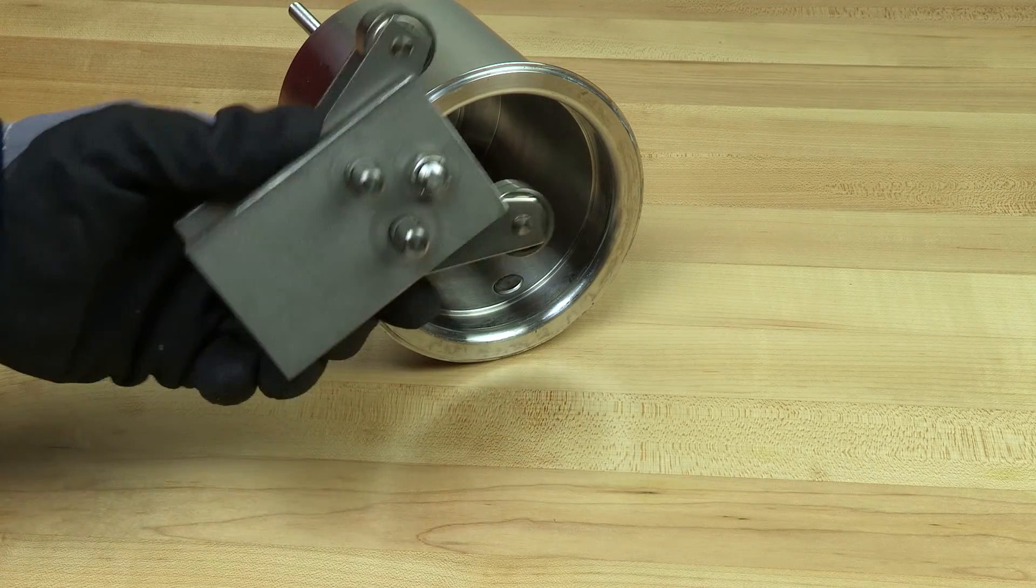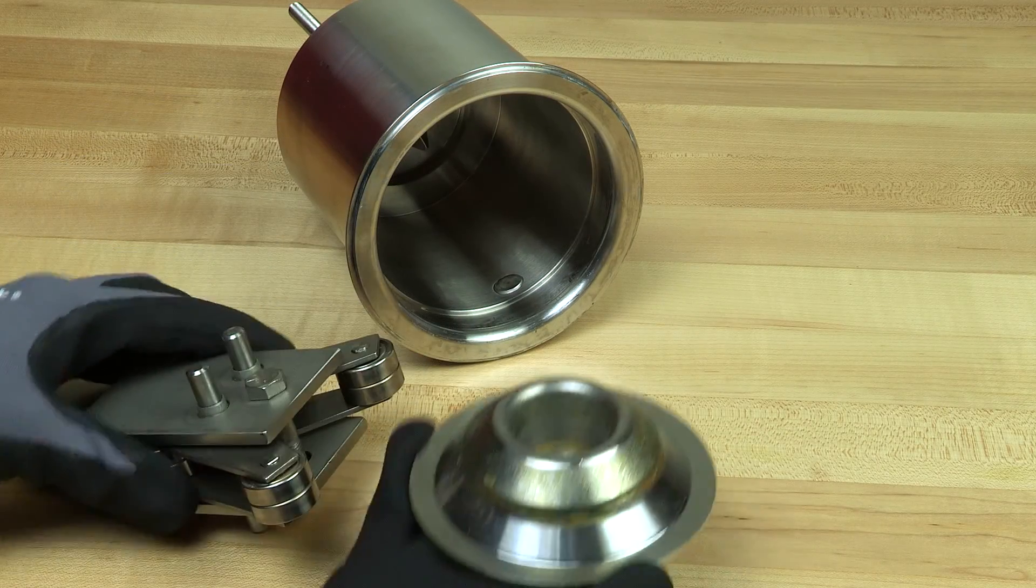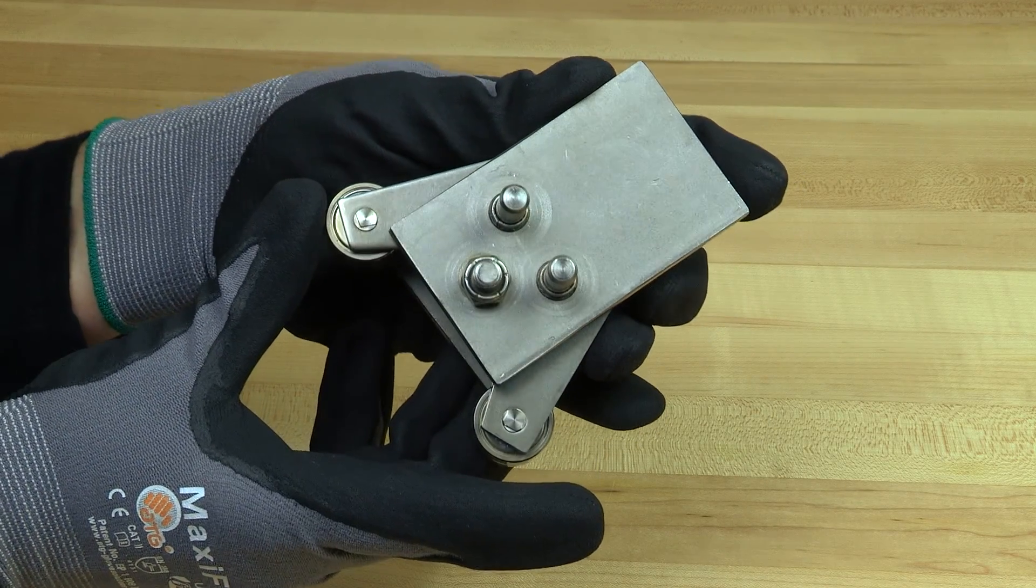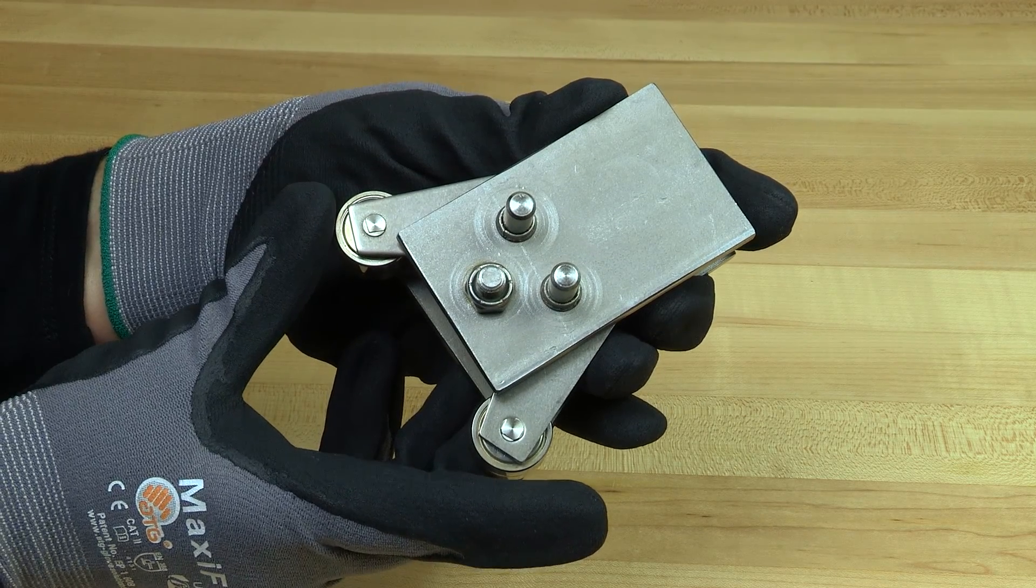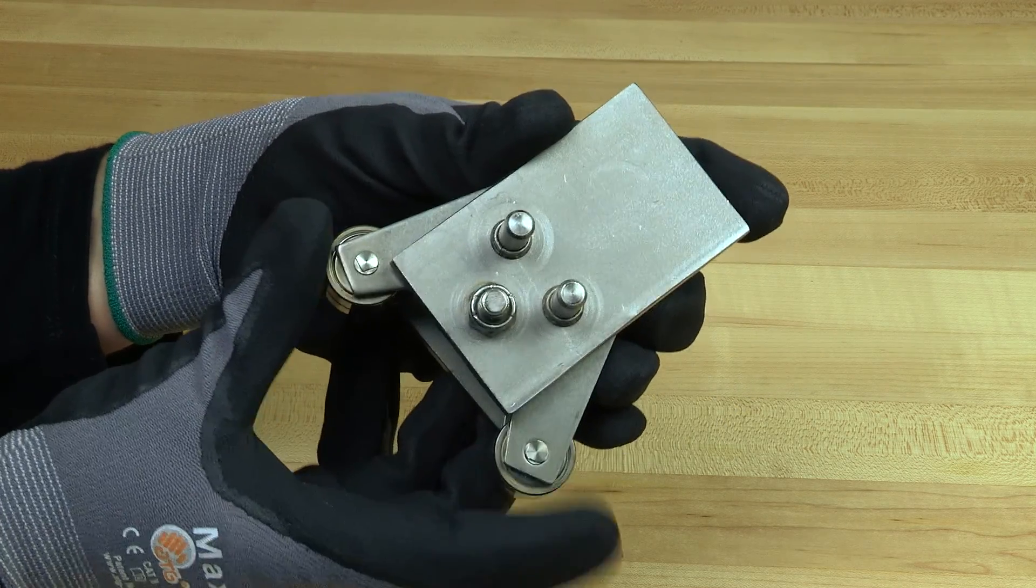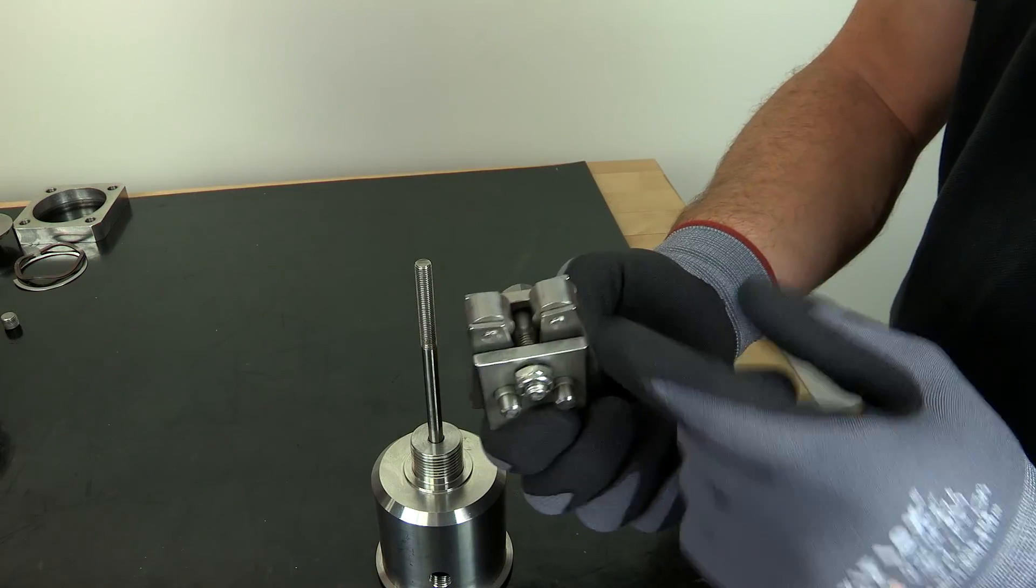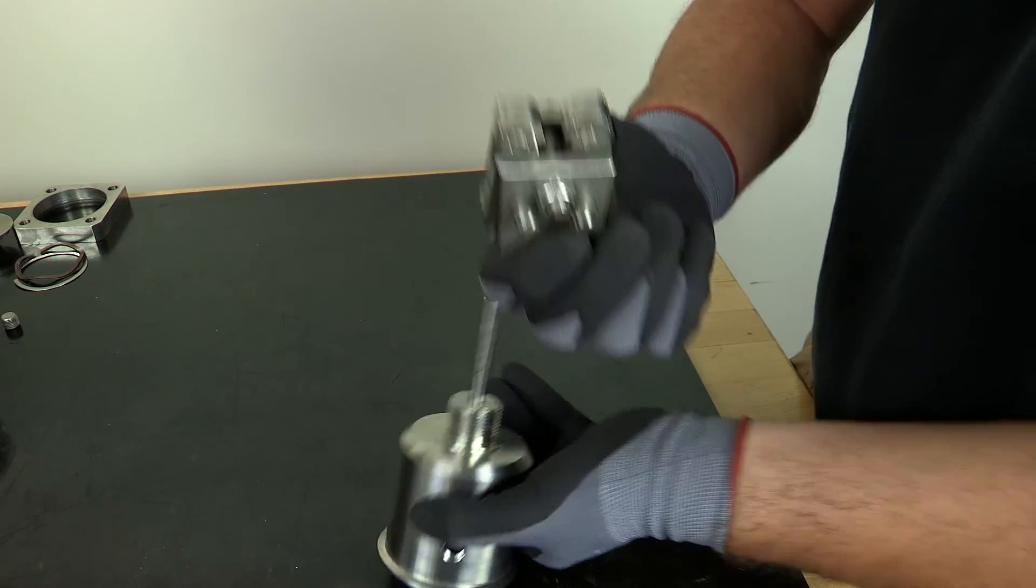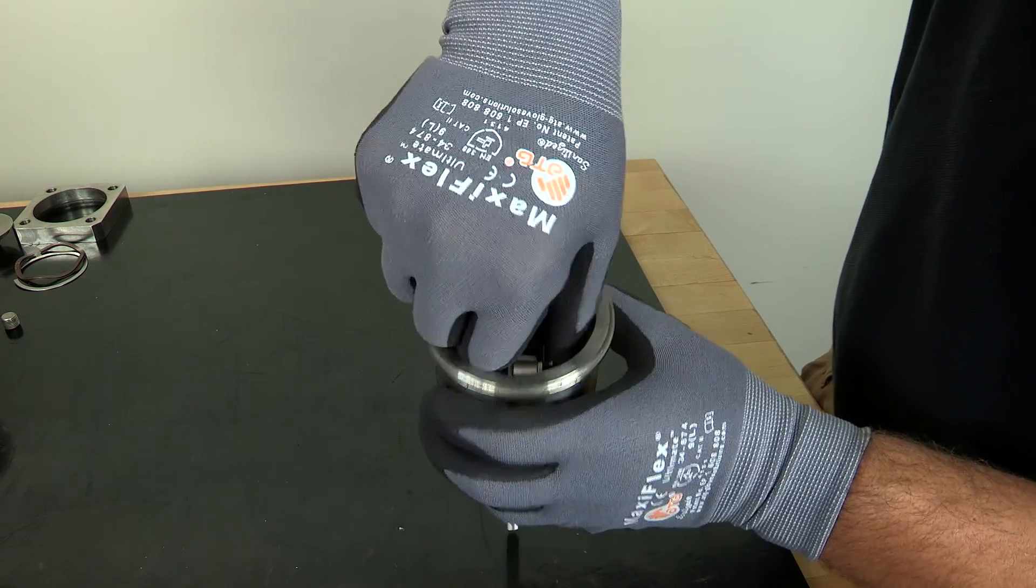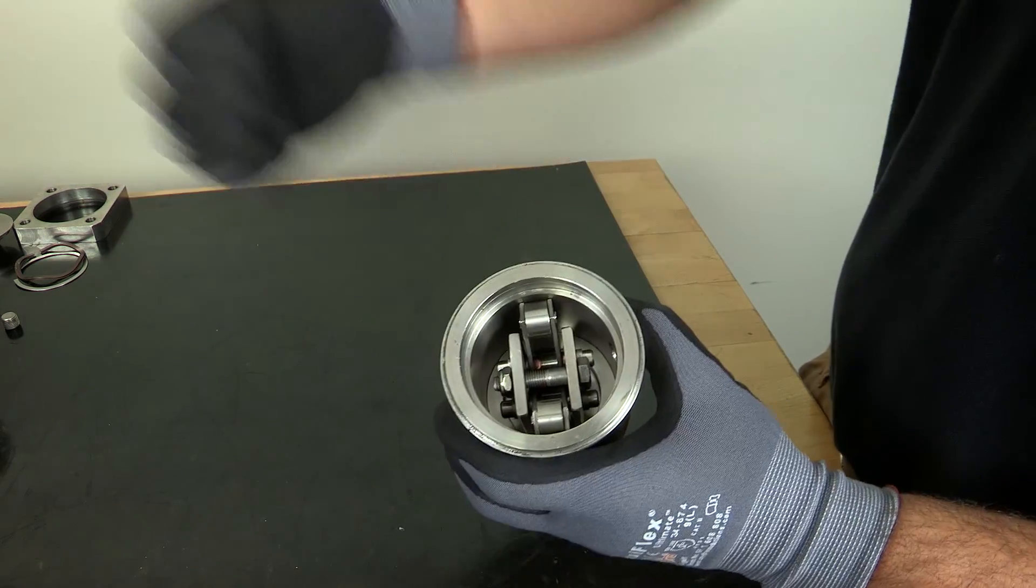The piston works with a drive mechanism which moves a compressor. The bottom rollers, which interface with the compressor plate, extend past the body of the drive mechanism. This is how to tell the top rollers from the bottom rollers. Install the drive mechanism into the bonnet over the wedge end of the piston and be sure to push the two bottom rollers open as far as possible.